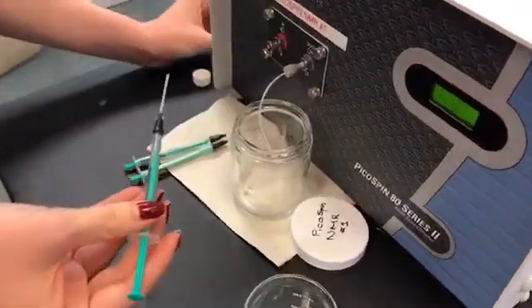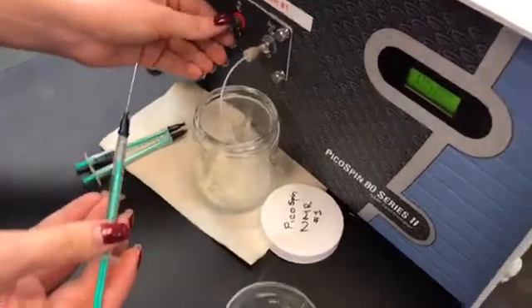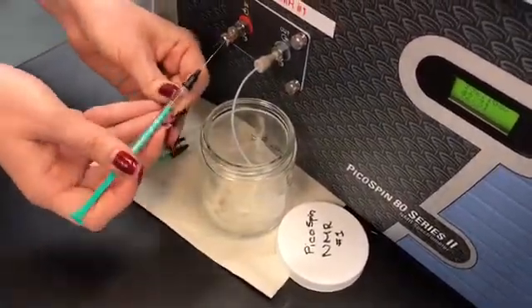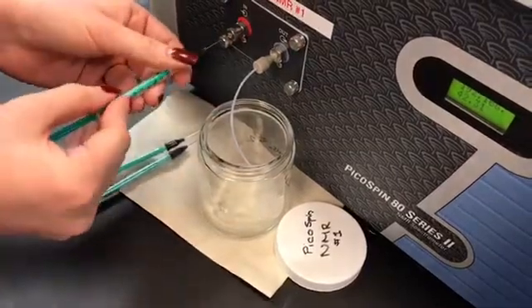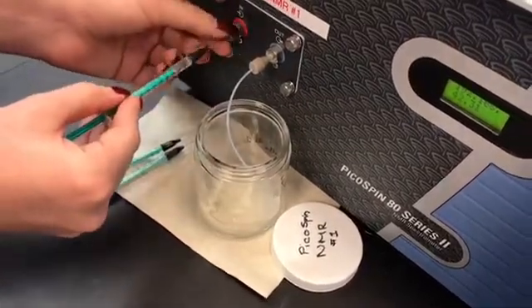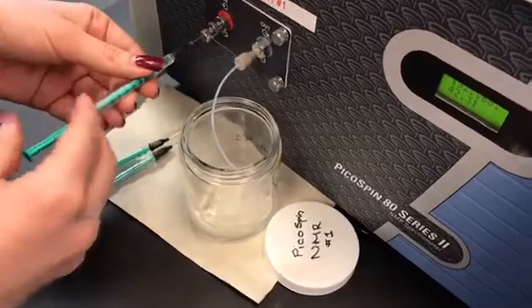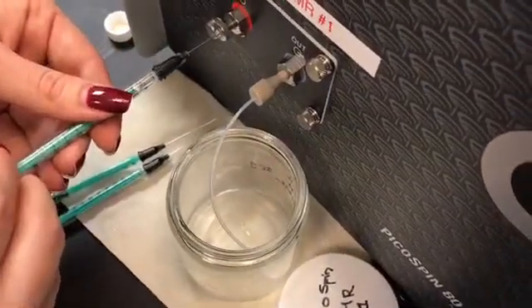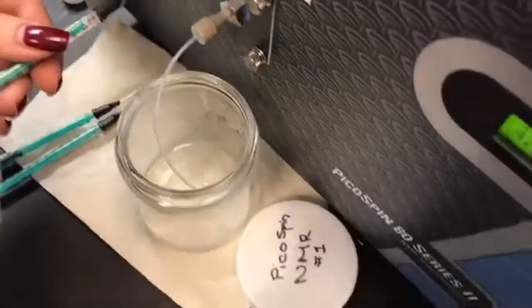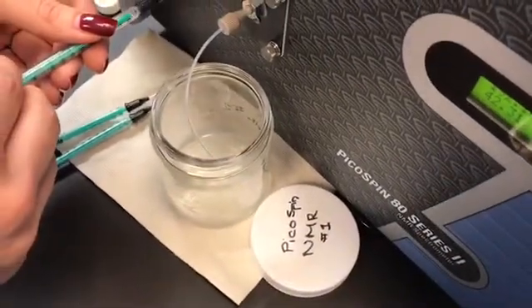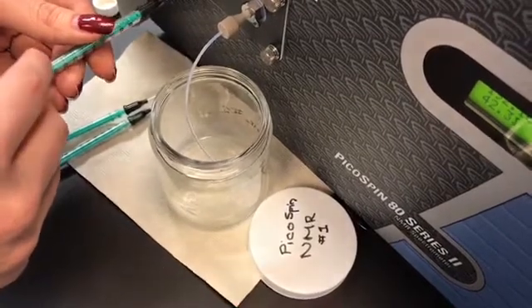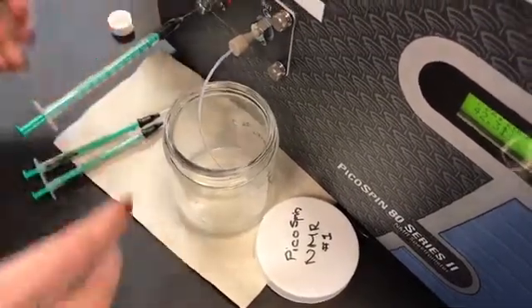And I'll make sure that this screw is loosened. Then, inject the syringe all the way until it stops. Tighten the screw, and slowly inject my sample. And at this point, I'm going to leave the syringe in the port.